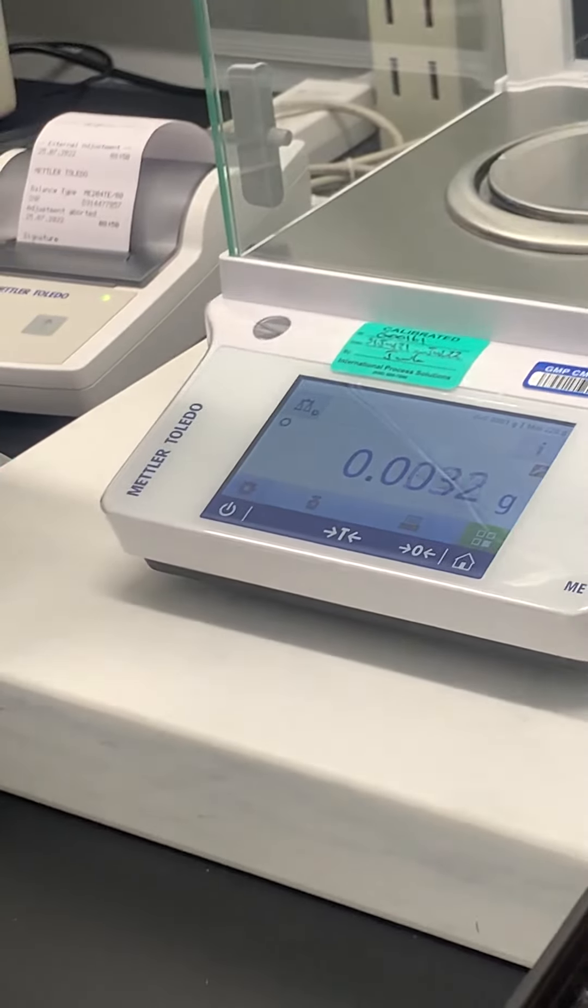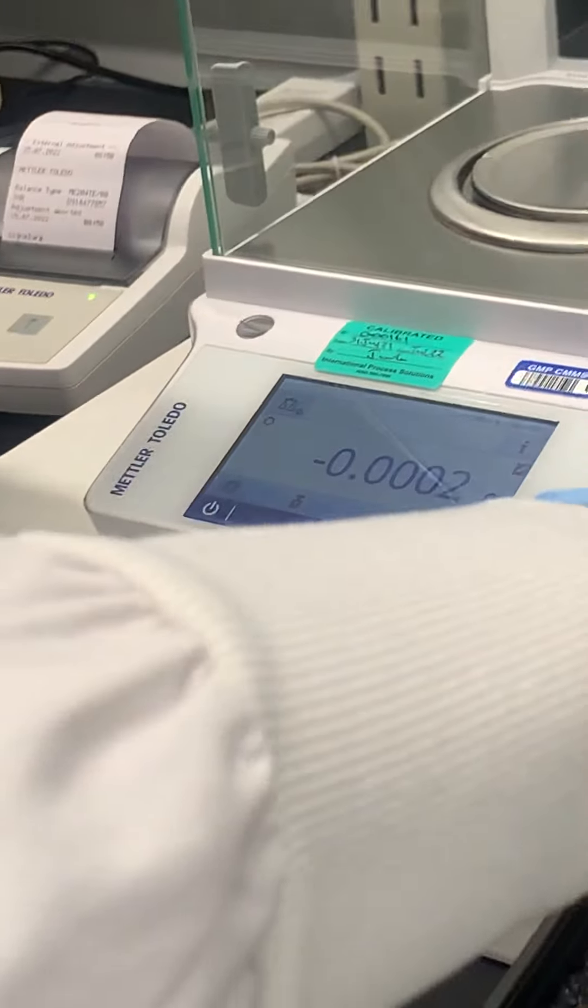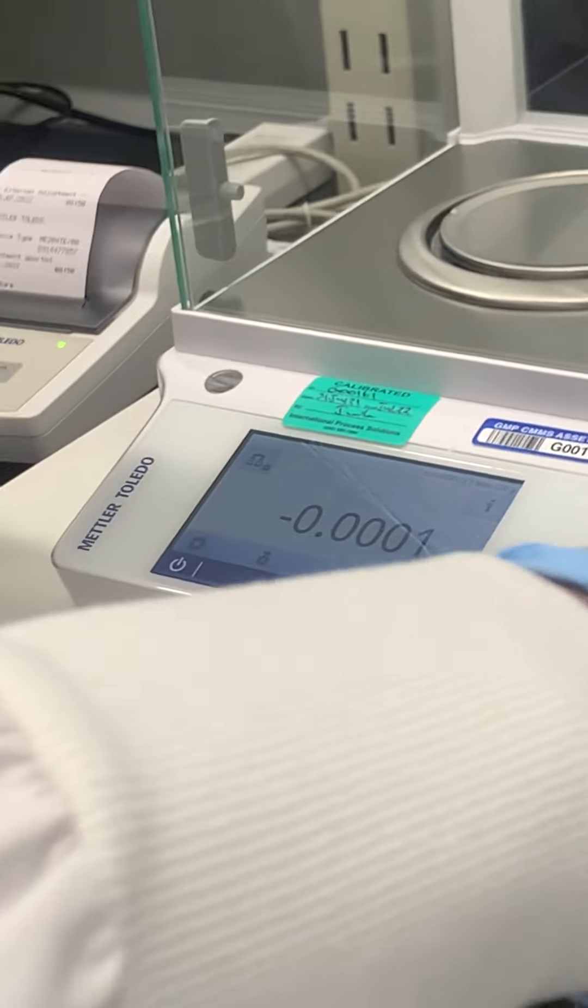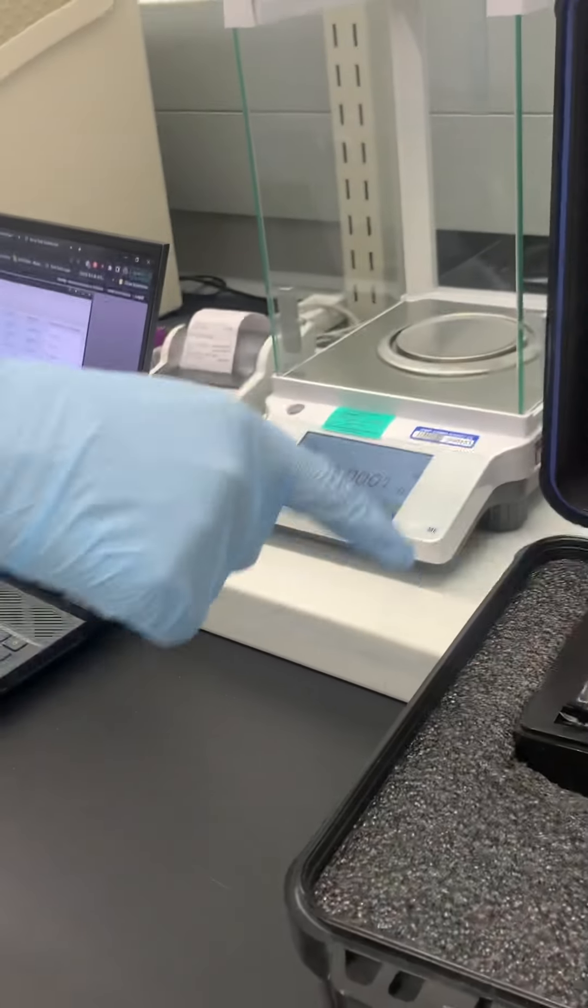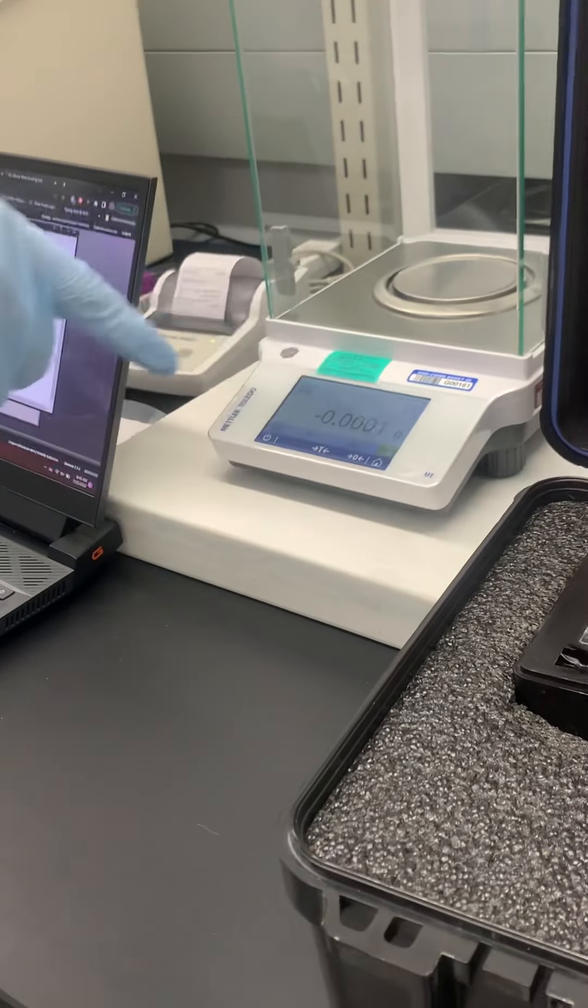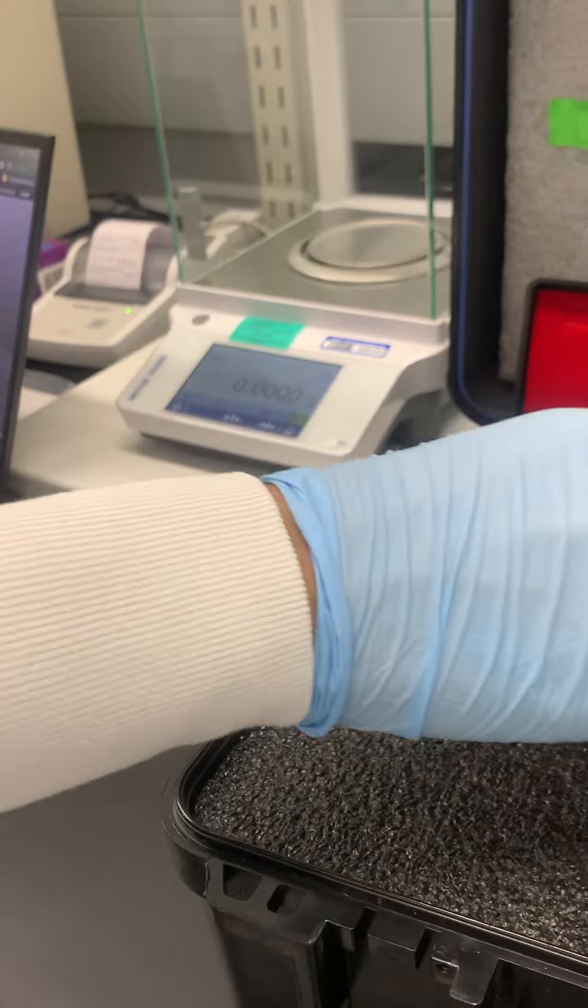What I'd like to do as well is that if I do use a weight, I can angle it a little bit, so I say 'oh this is the one I used' - just mark it later.